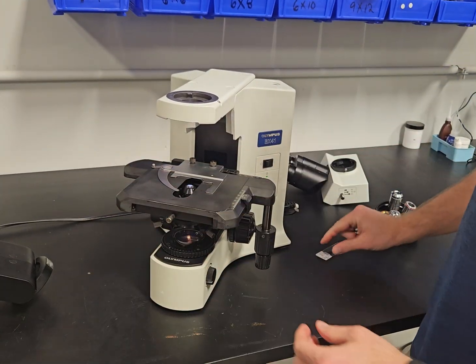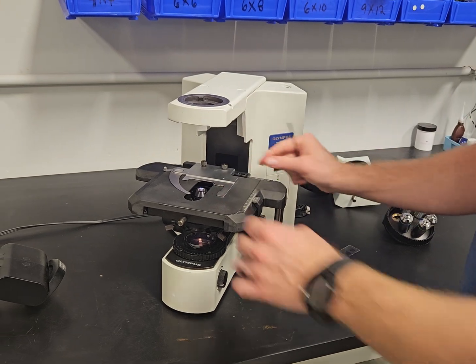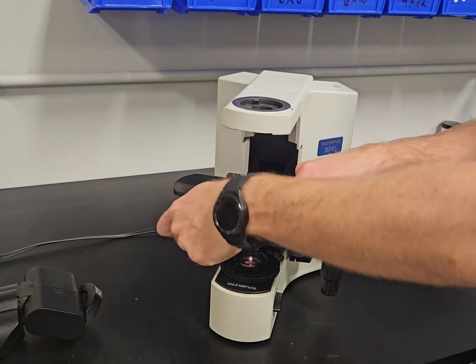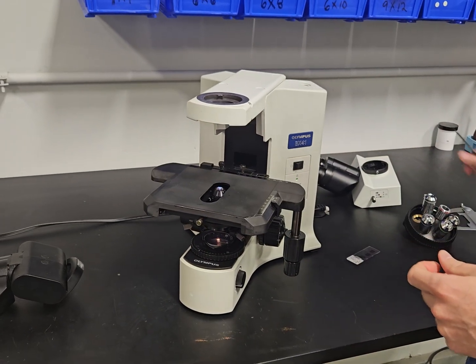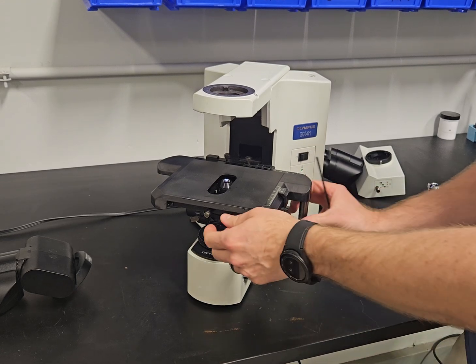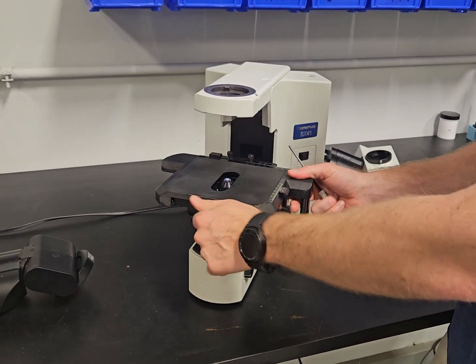We have a slide holder. This can be removed if you like to push the slide with your fingers. You can also get a lock stage that doesn't have this coax control, so it won't be in the way if you do push it with your fingers. We're going to take this off.